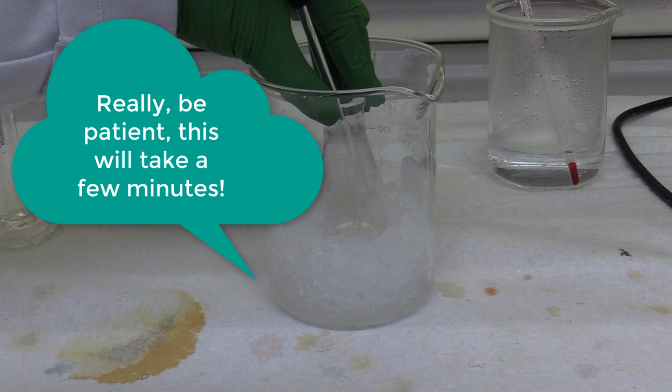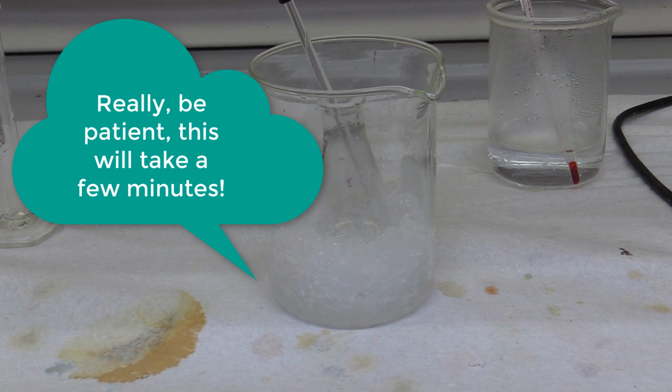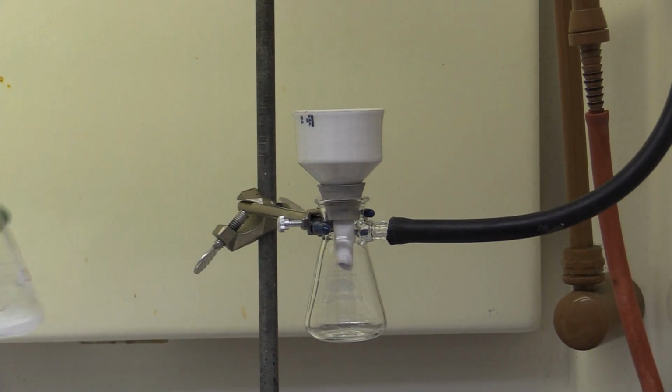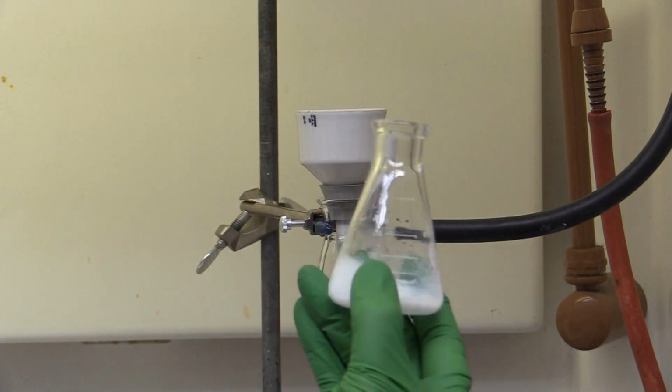Be patient. If, after 5 minutes, crystallization has not begun, scratch the bottom of the flask with a glass stir rod. Filter the crystals and wash with ice-cold water. Save a little bit for later testing.